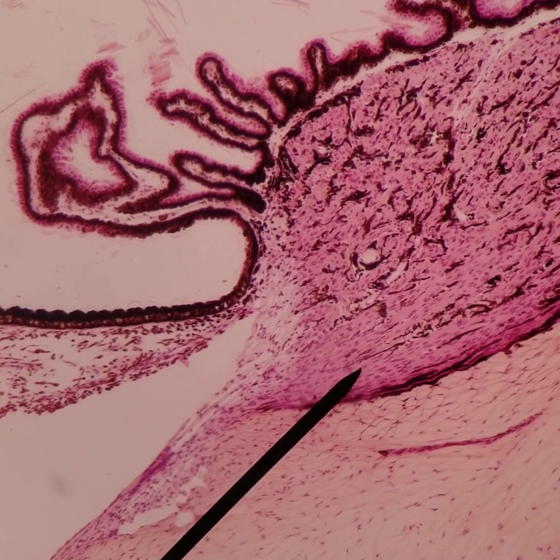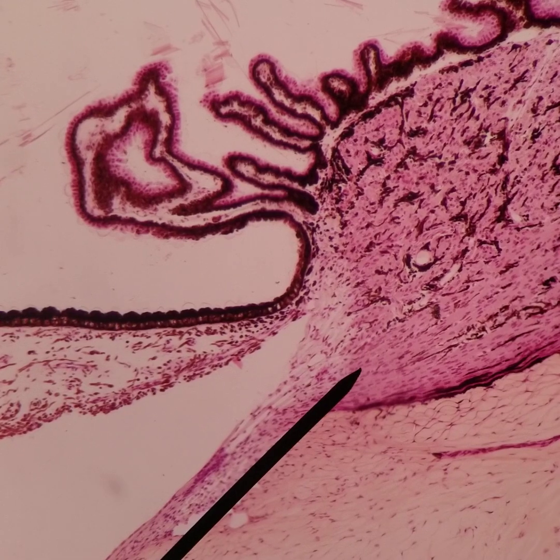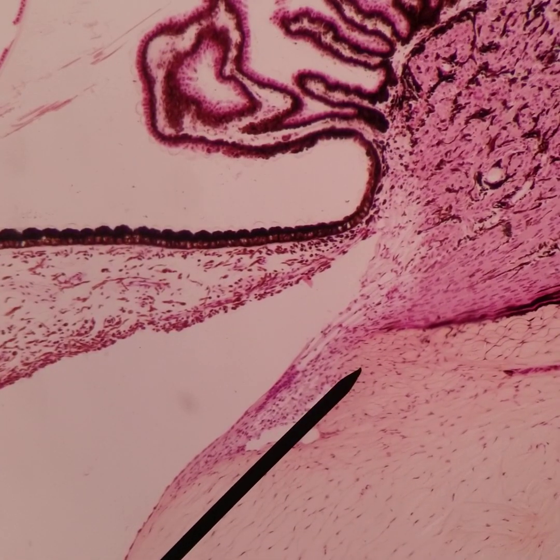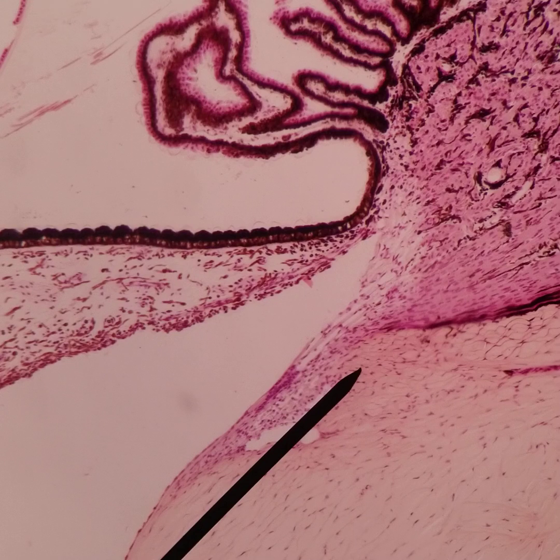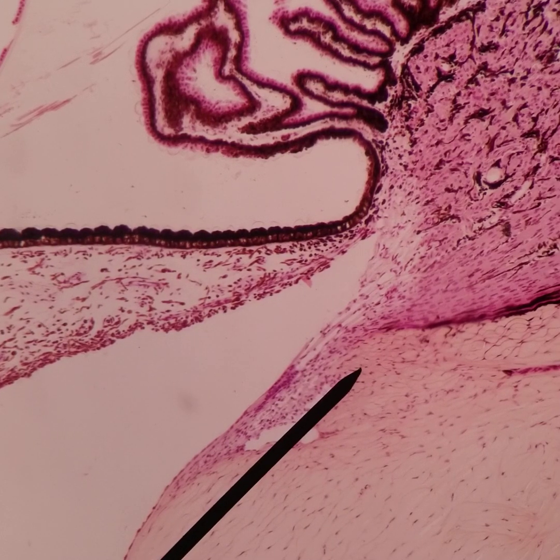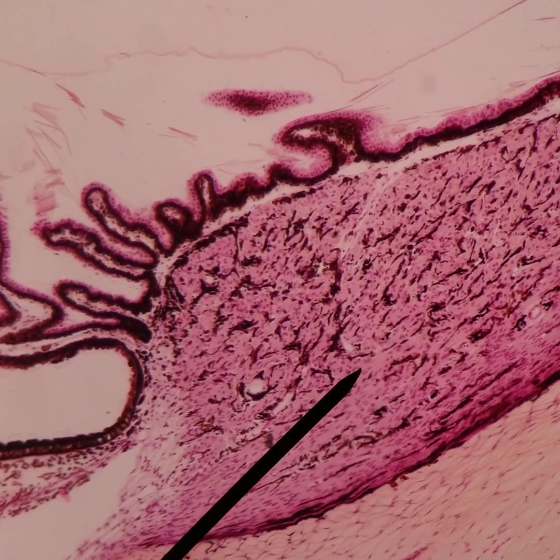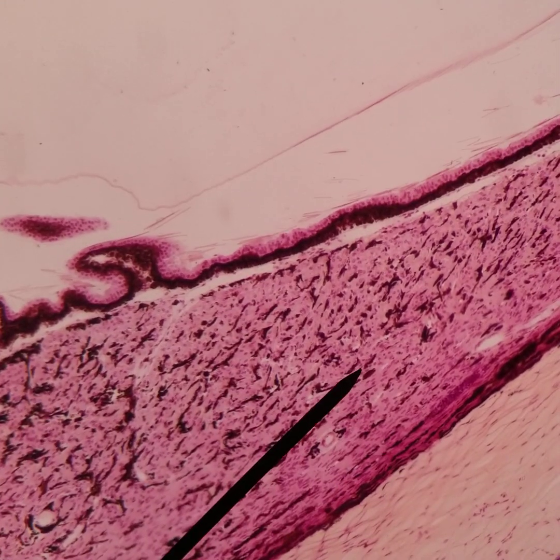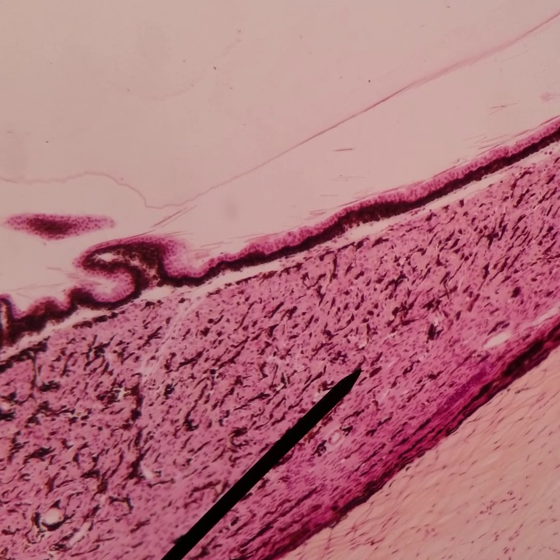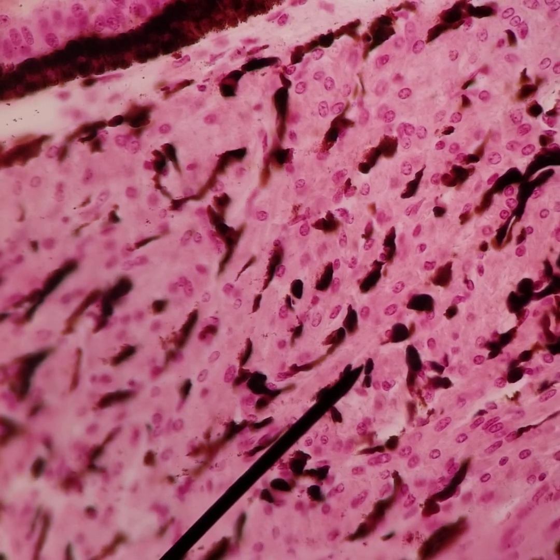The ciliary muscle fibers attach to the scleral spur, and that's why when the ciliary muscle contracts it pulls on the scleral spur. That pulling opens up the trabecular meshwork and can increase aqueous outflow.